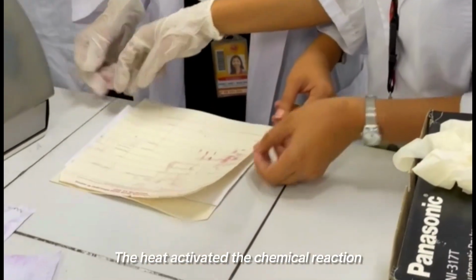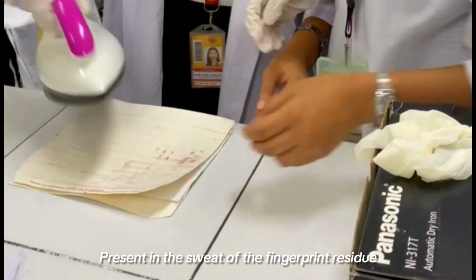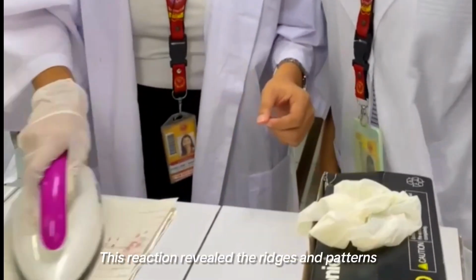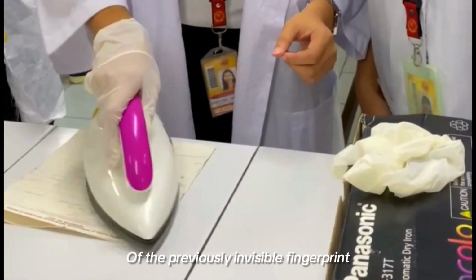The heat activated the chemical reaction between the ninhydrin and the amino acids present in the sweat of the fingerprint residue, forming Ruhemann's purple, a deep violet color. This reaction revealed the ridges and patterns of the previously invisible fingerprint.